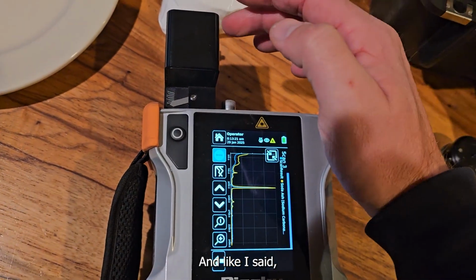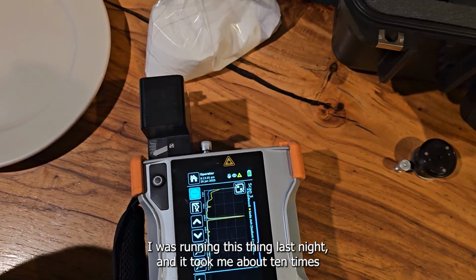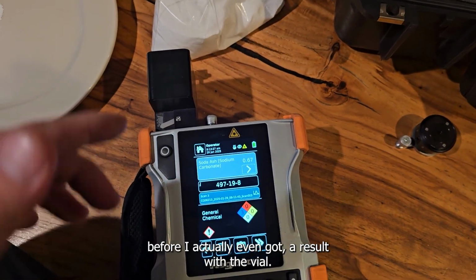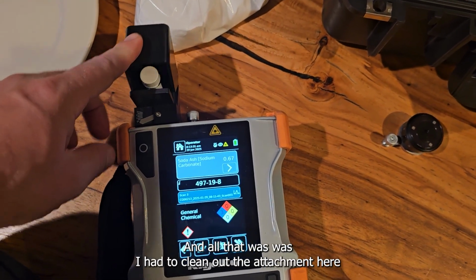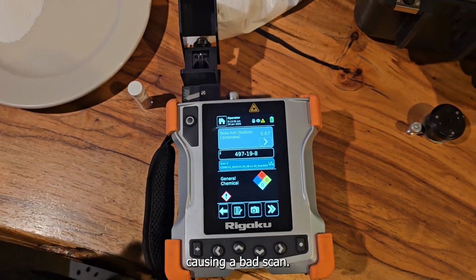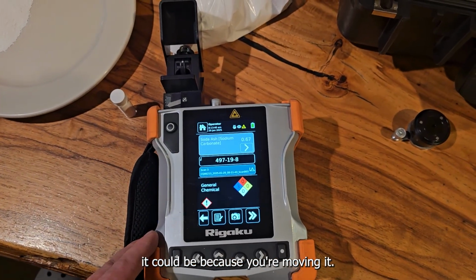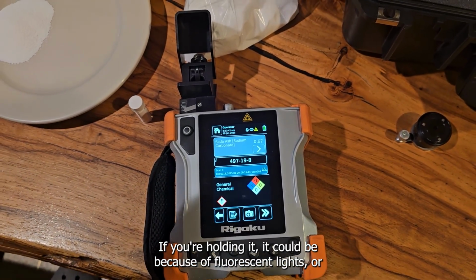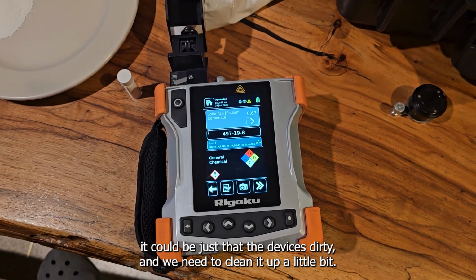And like I said, putting it in the vial and getting in there is going to be the best result. I was running this thing last night, and it took me about 10 times before I actually even got a result with the vial. And all that was I had to clean out the attachment here because something was in there causing a bad scan. So just realize if you're getting bad scans, it could be because you're moving it if you're holding it. It could be because of fluorescent lights, or it could be just that the device is dirty and we need to clean it up a little bit.